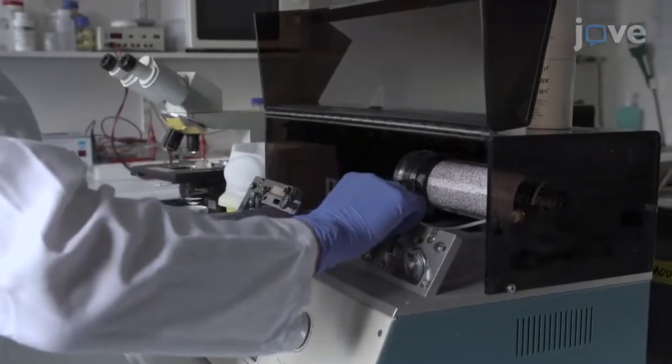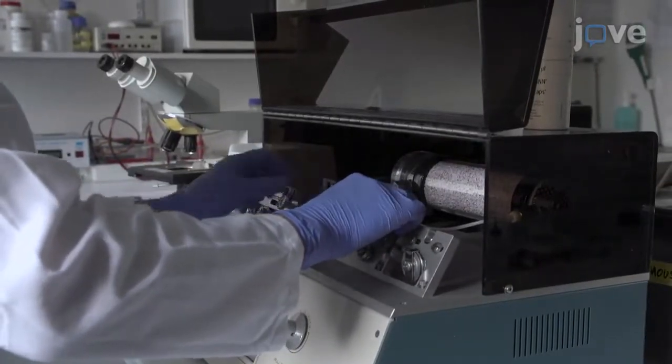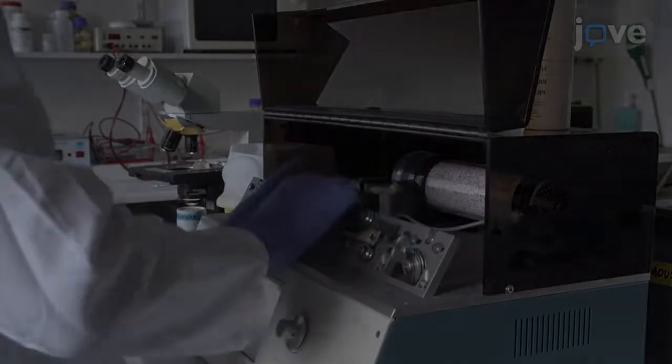To perform a search for responsive boutons, you need a suitable glass micropipette for electrical stimulation.